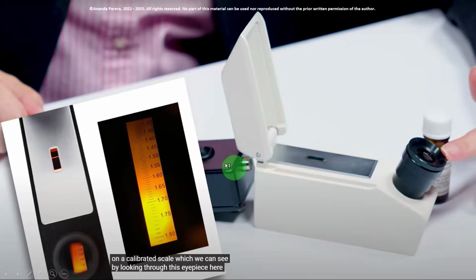Then after that, this is the light. There is a hole on this side. Then the light goes through the hole inside. Then we can check from here. This is the eyepiece. When we look, the calibrated scale is inside the machine. We can see it like this.